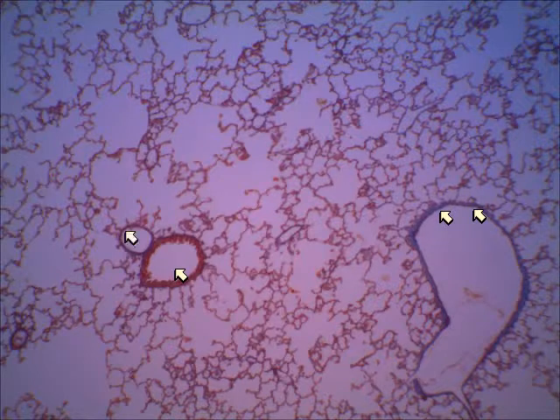All right, remember that blood vessels are lined with an endothelium whose surface is simple squamous epithelium, so it's going to be very flat there. Whereas the bronchiole is more stratified and has more of the cuboidal. It somewhat goes from the pseudostratified to the cuboidal as you move from the trachea into the bronchiole. But it's going to be much thicker and a little bit wavy.